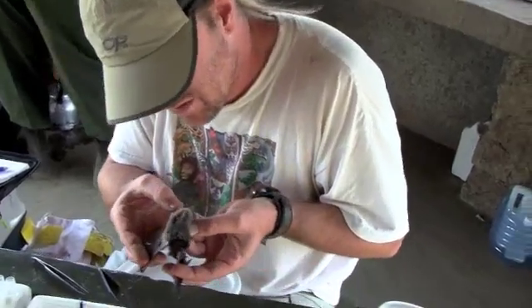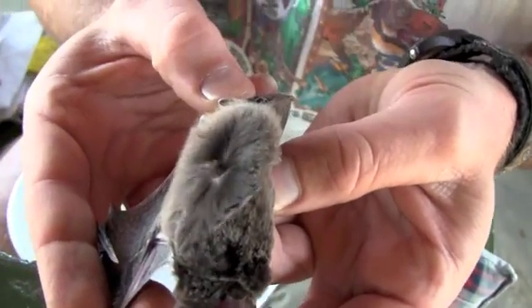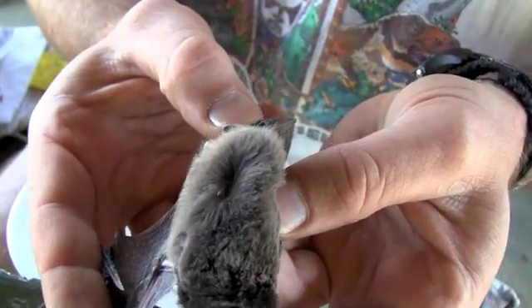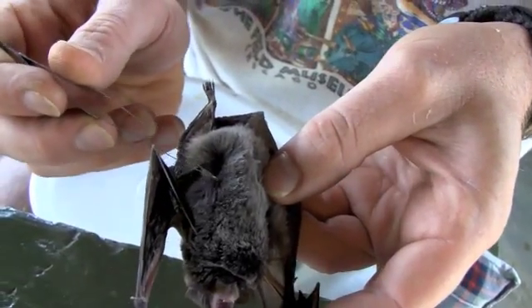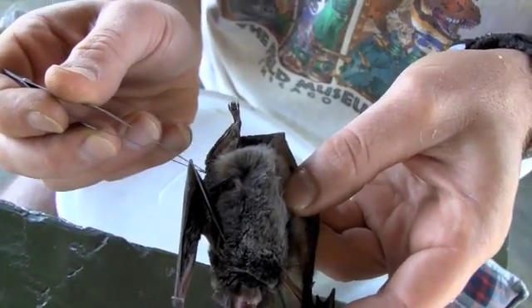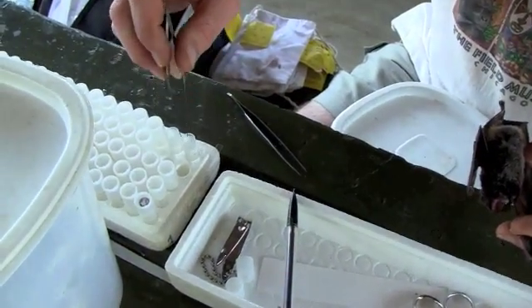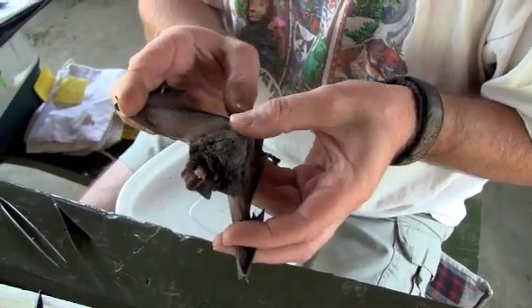Here's one for example. And you can see if I blow in here, they're not always that evident, but sometimes. And then I can just pick them out. And even in death, they often adhere to the fur, to the hairs — I presume by their tarsal claws.